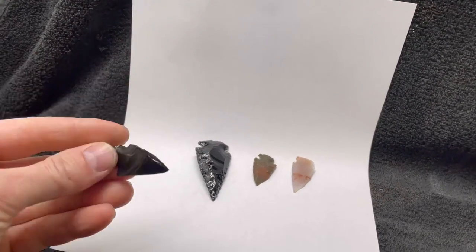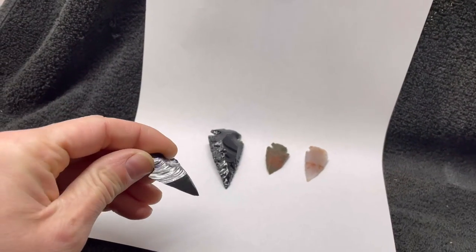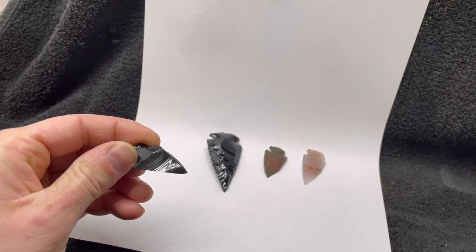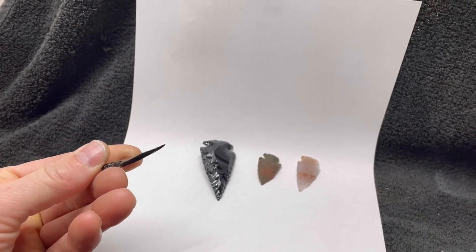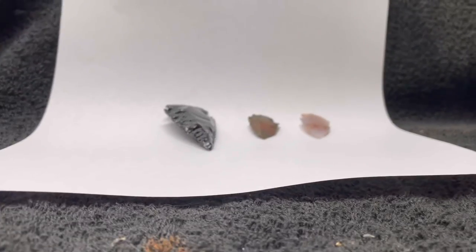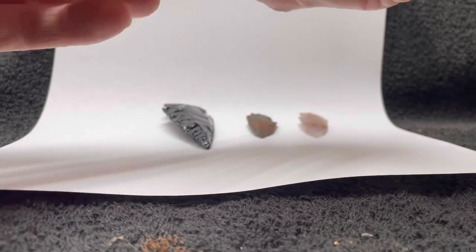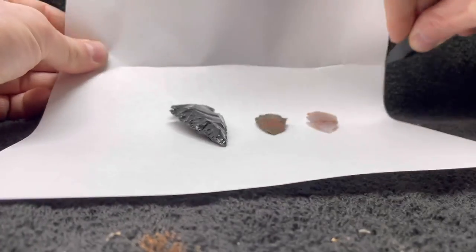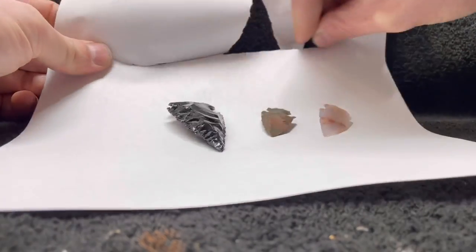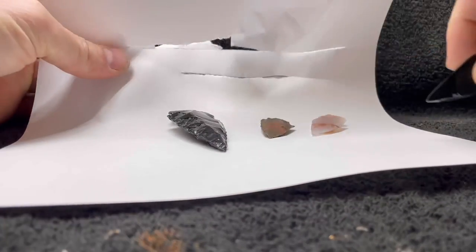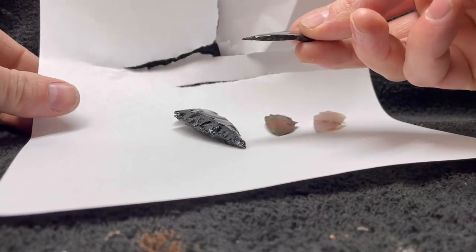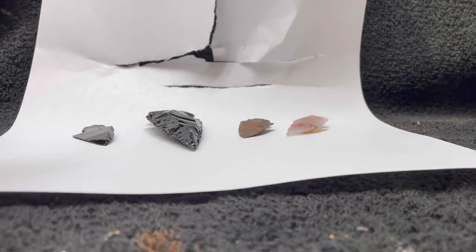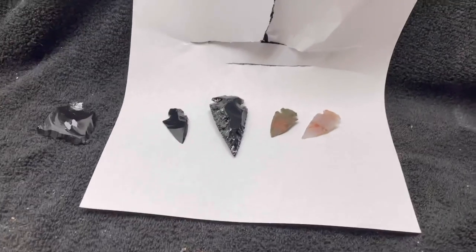The question is what's going to happen as it's dissolving? Will it reveal any kind of interesting patterns or will it just dissolve it kind of smoothly? What about the sharp edge? Will that be blunted by the acid or will it get even sharper? I don't know. So today we're gonna find out.